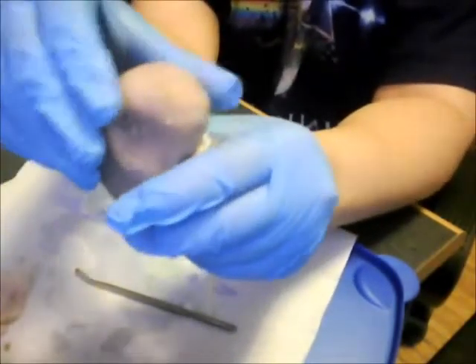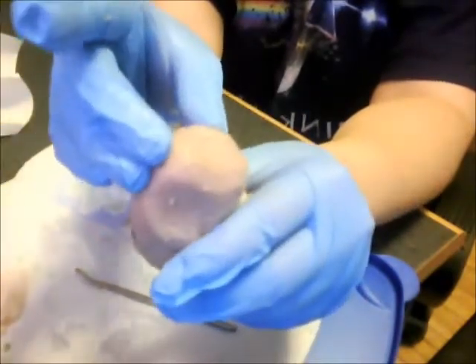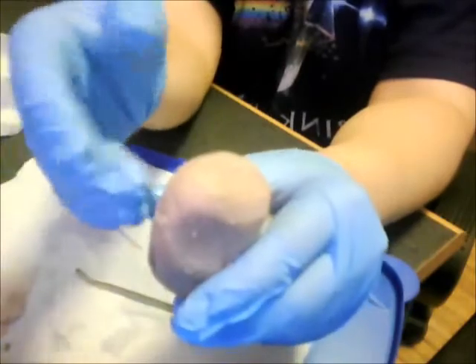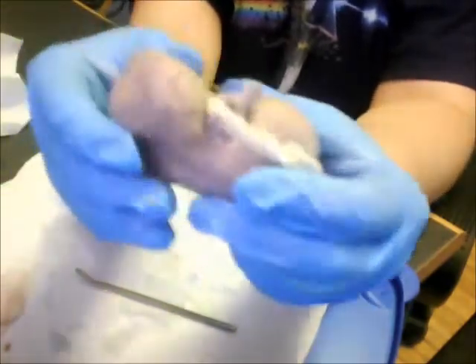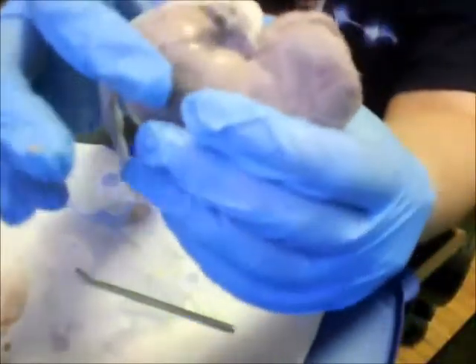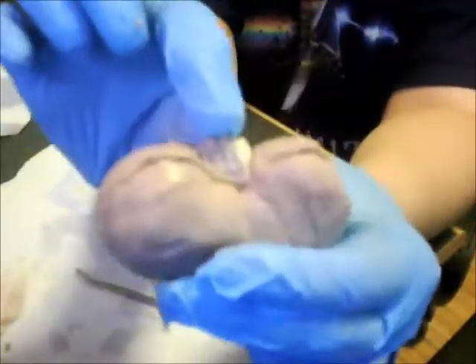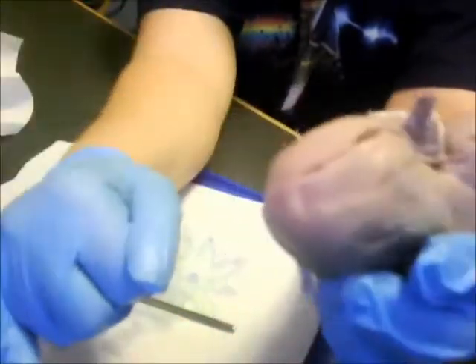And on top of the renal capsule and the kidney, I noticed that there was a little piece of tissue going around the top, and I think that has something to do with the adrenal glands sitting on top of the kidneys. And if you go up closer, you'll notice the renal arteries, renal vein, right there.